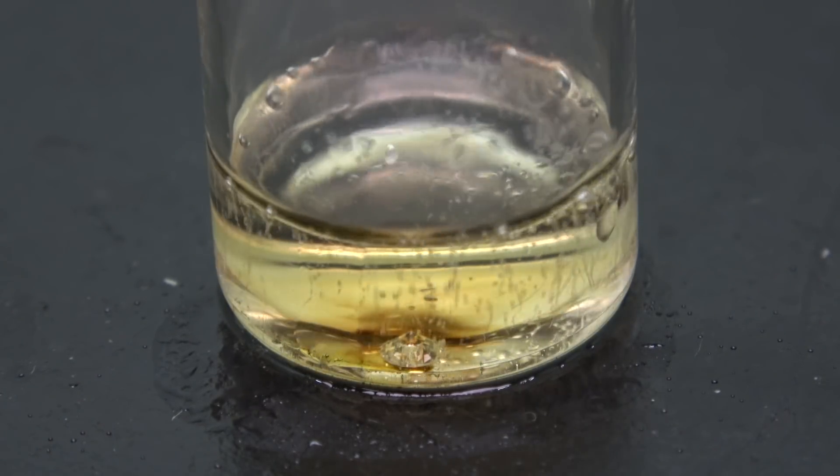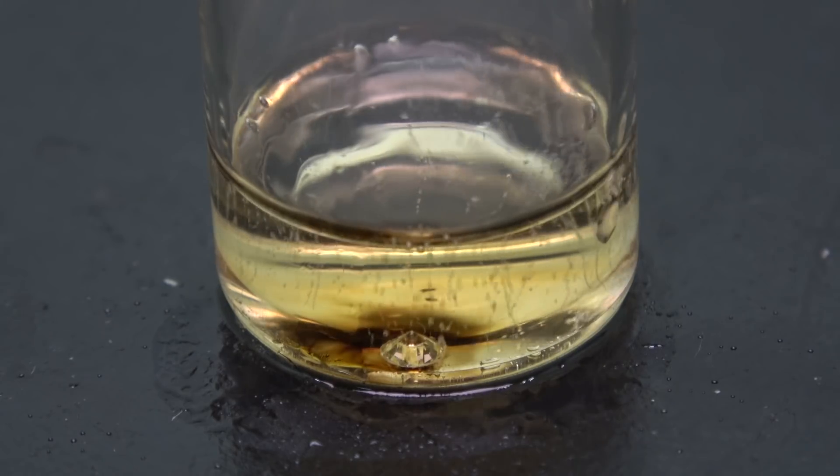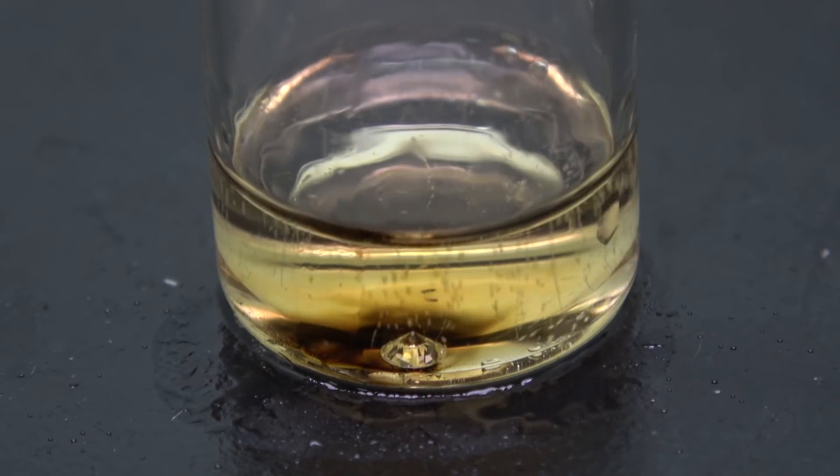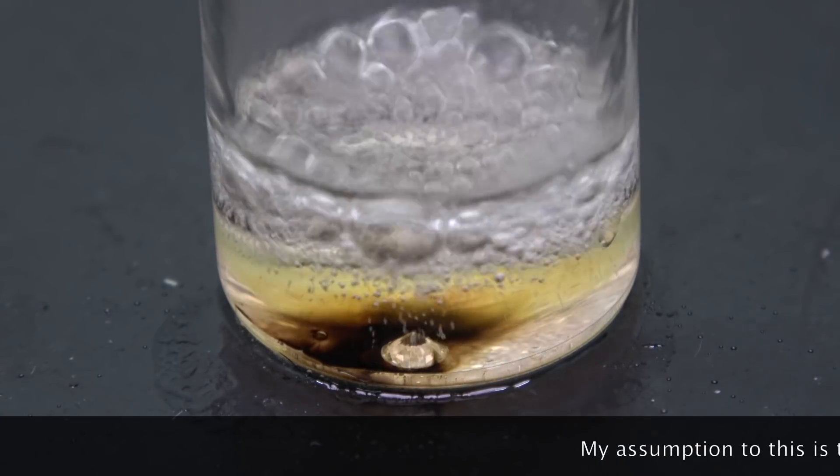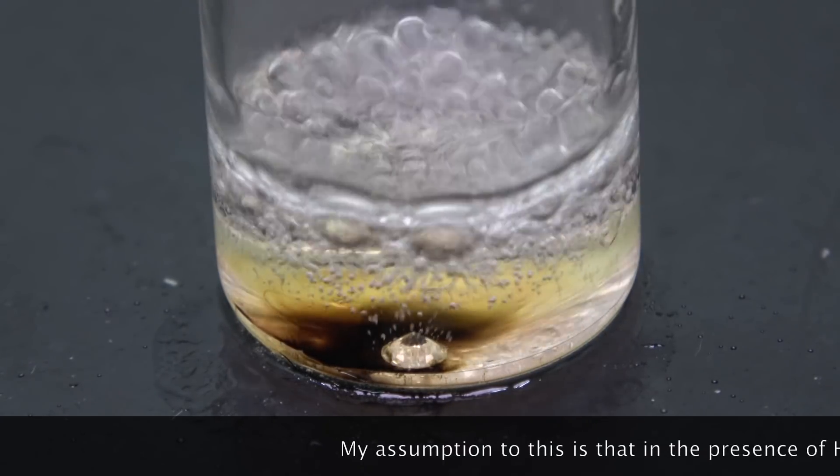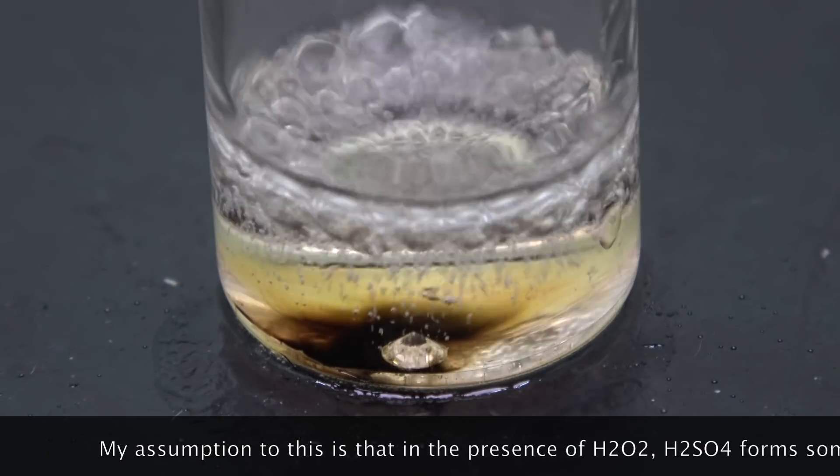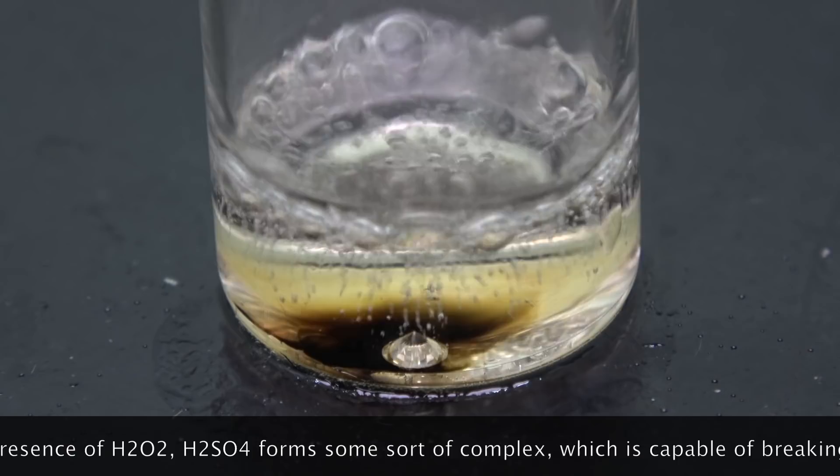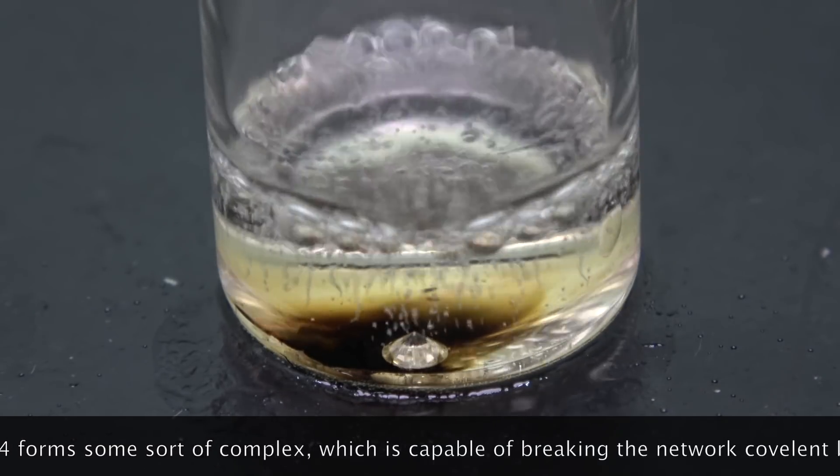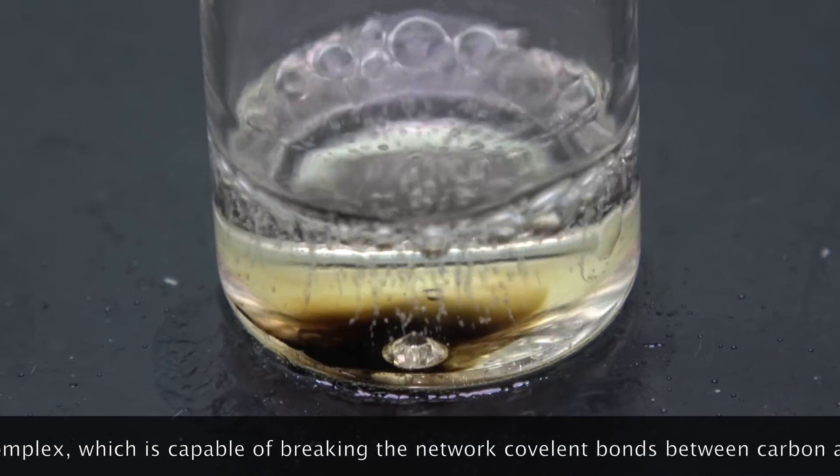Okay, let's go back to watch the video. The carbon magically reappears. Although I'm not 100% sure what exactly is going on at the molecular level, what I can see is the diamond is definitely reacting with the acid mixture. Apparently, this is the first footage ever recorded of a diamond reacting with oxygen at a low temperature.